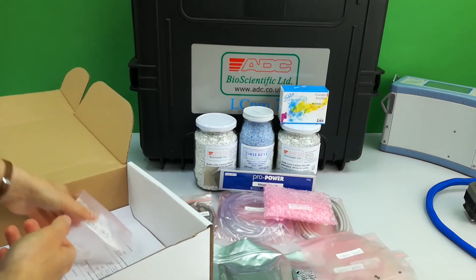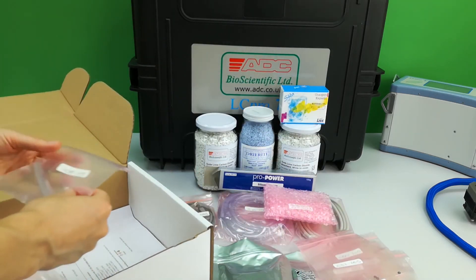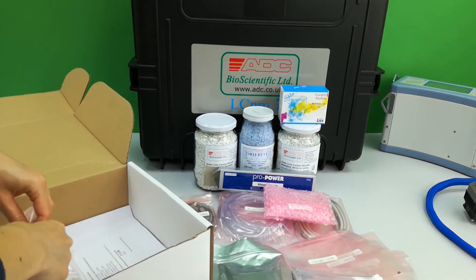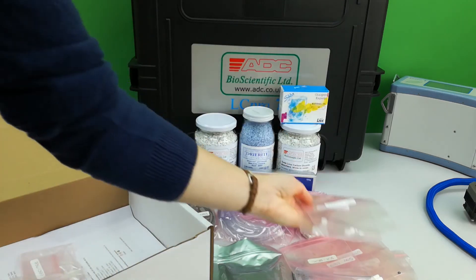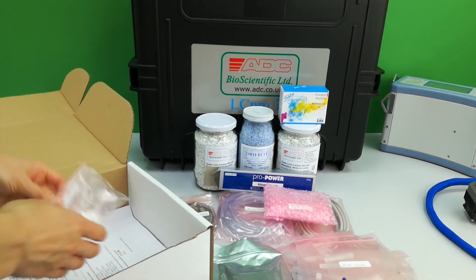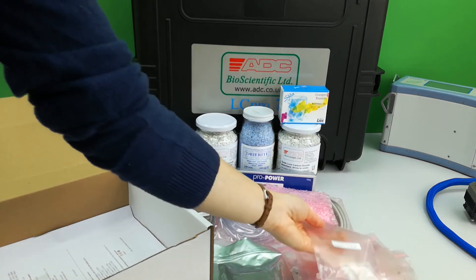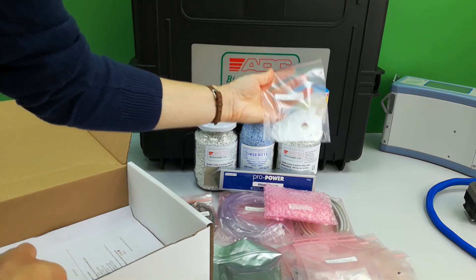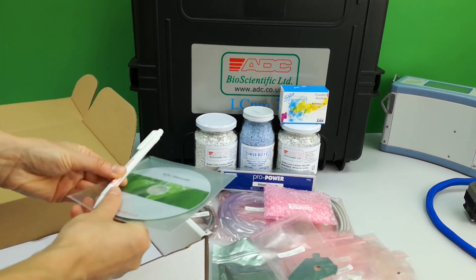A set of internal use filters is also supplied, along with a set of spacers for placing between chambers, adapters for attaching more than one piece of tubing, T-pieces, and more filters for internal replacement. A tool assists in installing a CO2 cylinder. A CD of ADC manuals and a pencil are also provided.